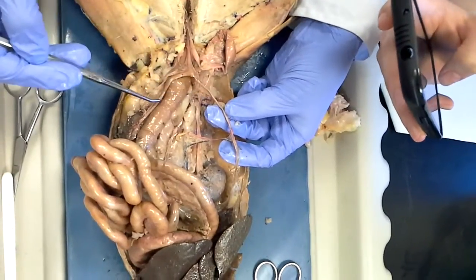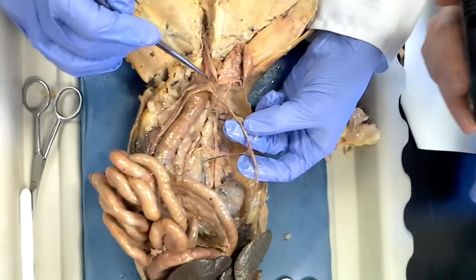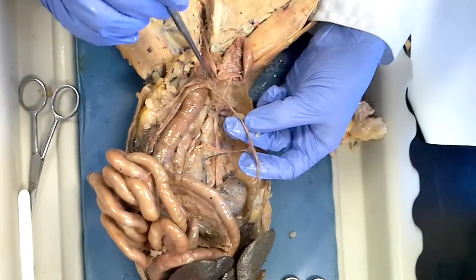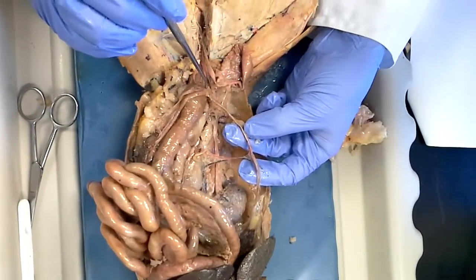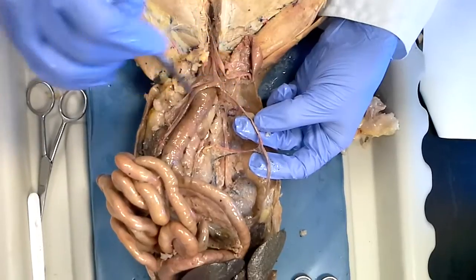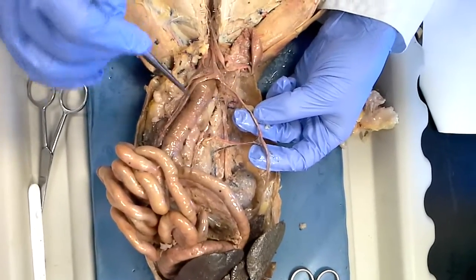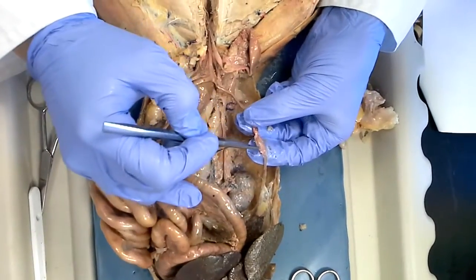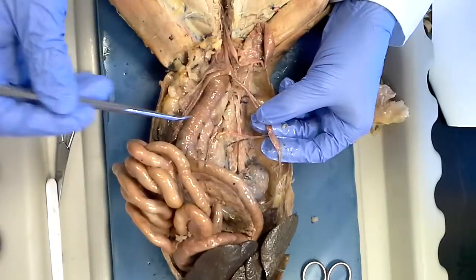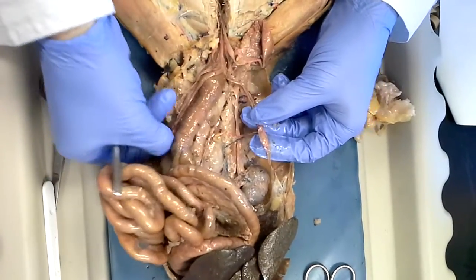This right here, and the same on the other side, are actually parts of the uterus called uterine horns. They both connect to the body of the uterus here. So if I labeled this central area you would say uterus, but if I labeled one of these branches you would say uterine horn. Again, this is the ovary and up here is the oviduct — you can see that on both sides.